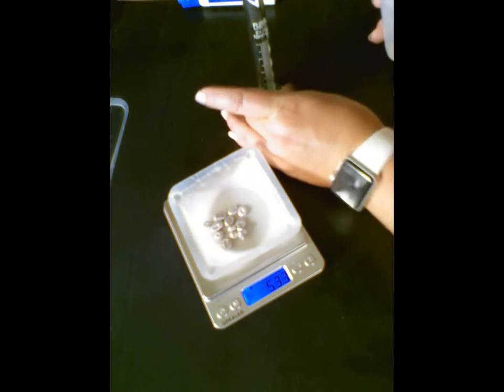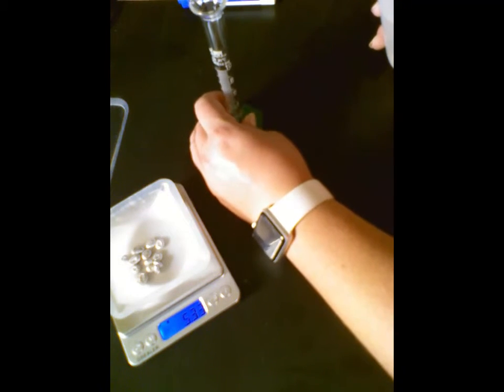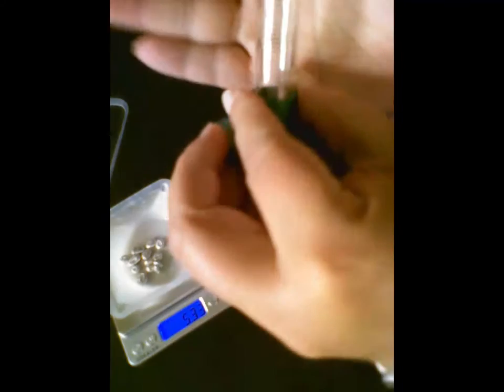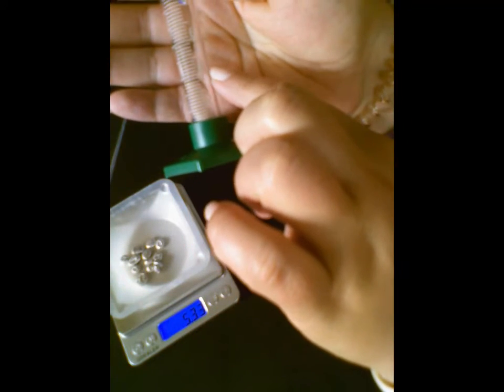Then we need to set up our graduated cylinder to do our water displacement. You learned about water displacement last week when you were learning about how to calculate density. To do water displacement, we're going to use this squirt bottle, which just has some water in it. It's a little bit easier to control how fast the water comes out if I use the squirt bottle. I am going to use this graduated cylinder right here. This is a 10 milliliter graduated cylinder, and I am going to fill it up to the 4 milliliter line. I don't know how well you can see that on here. Here's the graduated cylinder, and I'm going to fill it up to this 4 milliliter line right here.